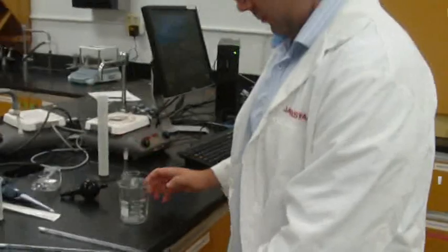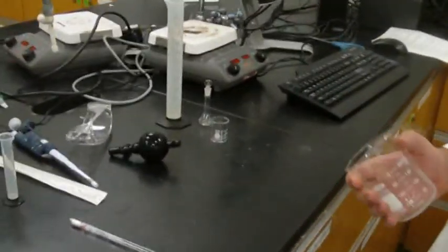Grab some water. Okay, so Jason is beginning lab 1. He's getting all of his materials prepared. Here he has three tools to measure out 1 milliliter, right, Jason? Right. What are the 3 that you're going to use to measure out 1 milliliter?